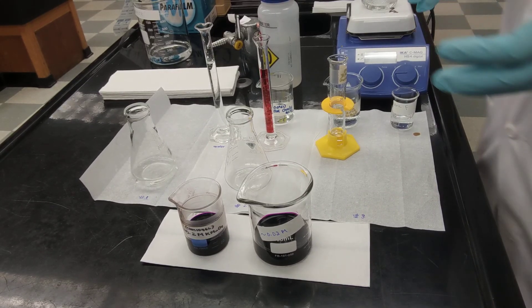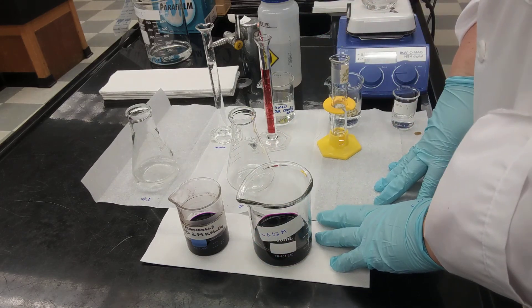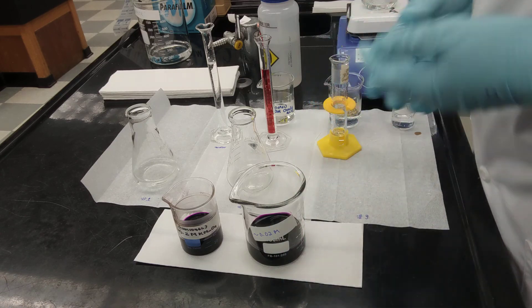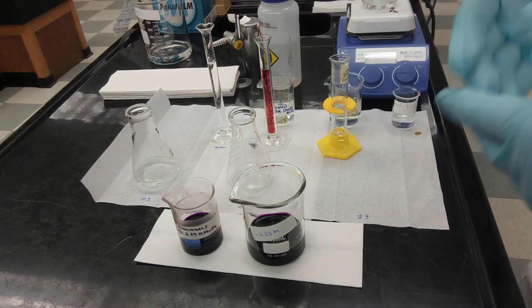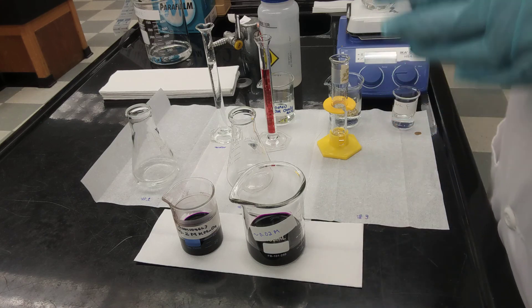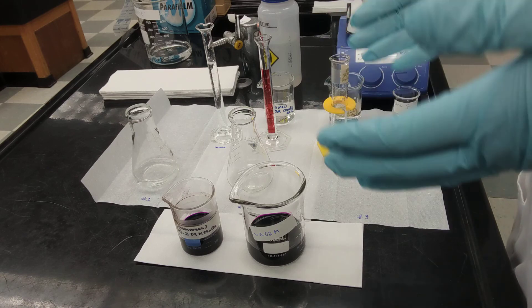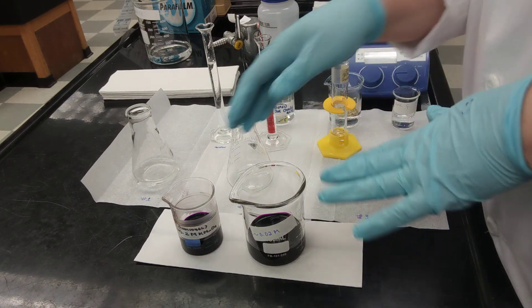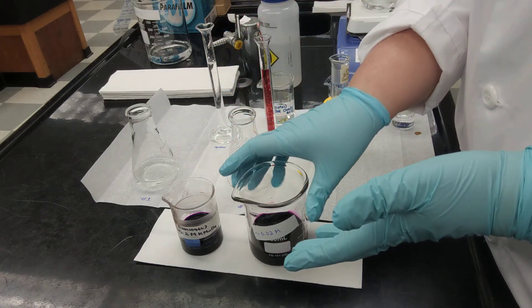I'm going to present a brief explanation about the experiment redox titration. In this experiment, we're using potassium permanganate to titrate oxalic acid. The titrant is potassium permanganate, which is this dark purple solution that I'm showing you here.